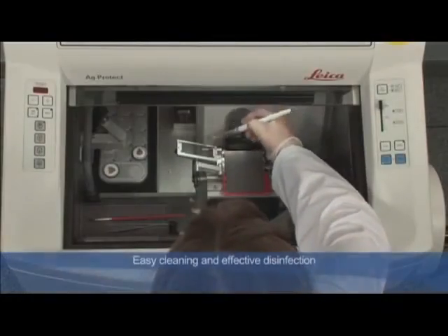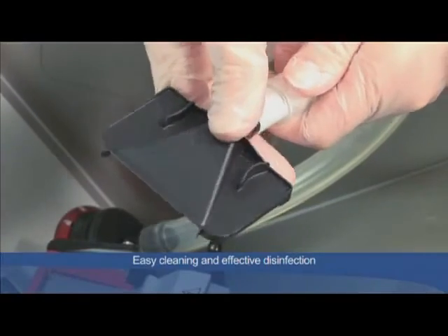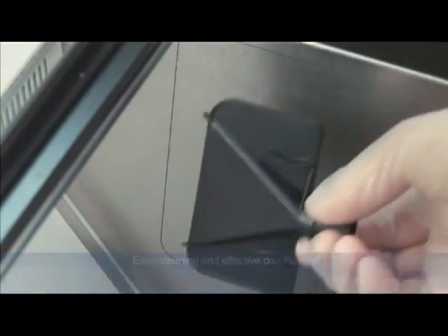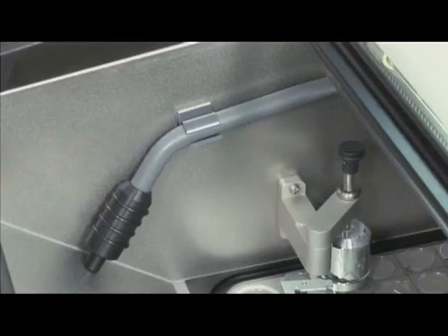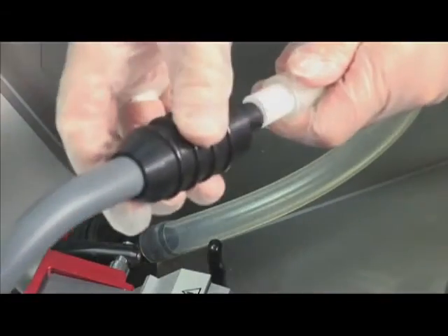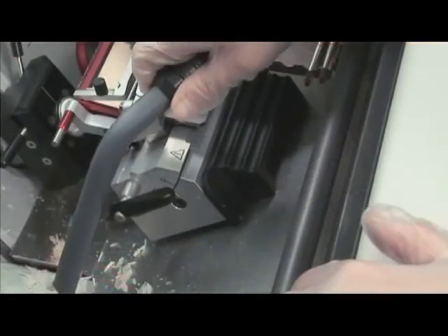The cryostat can be cleaned easily and quickly. The cleaning nozzle of the vacuum system is attached and section waste is collected in a filter.